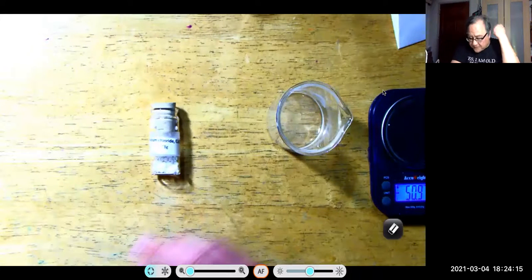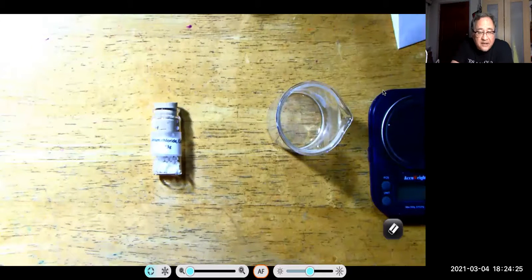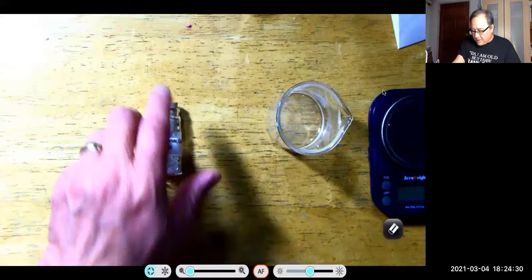And for this one, just pretend you have lithium carbonate and you just measured the mass. Figure out how many grams of calcium chloride you're going to need to react with that and double it. Okay? So what I'm going to do with that now is pretend I've made the calculation.